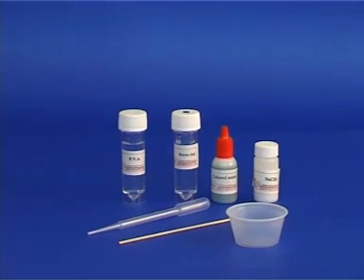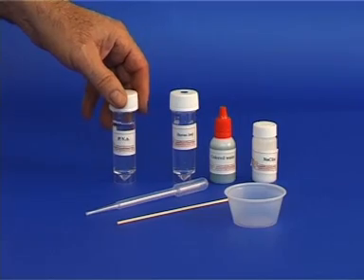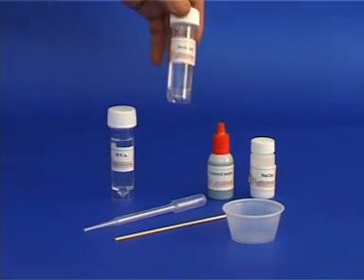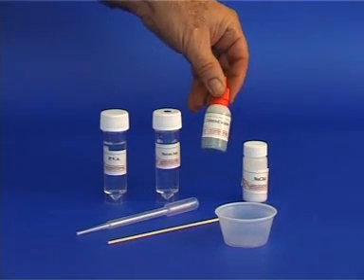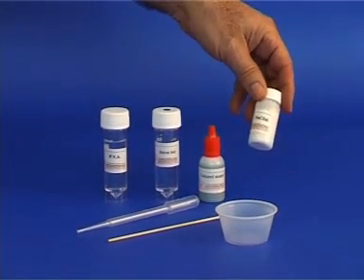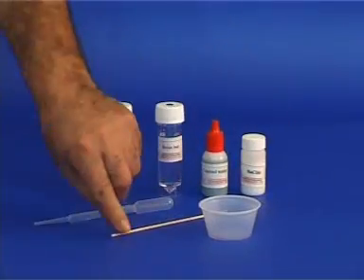Let us examine what we need for this experiment. A vial with PVA, which stands for polyvinyl alcohol, a borax solution, a small bottle of food coloring, and common table salt. We also have a small plastic container, a dropper, and a stirring rod.